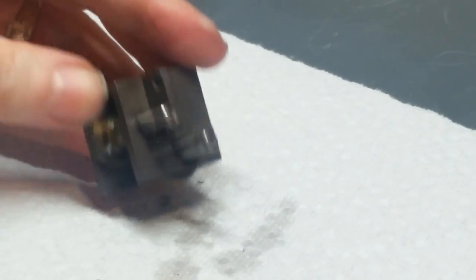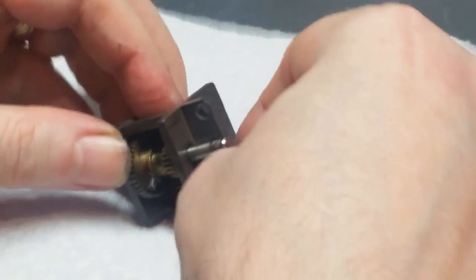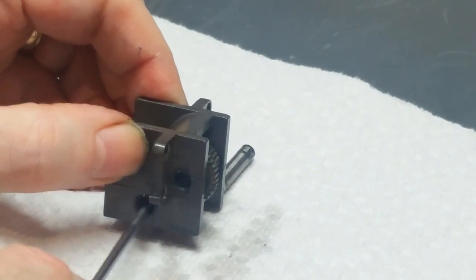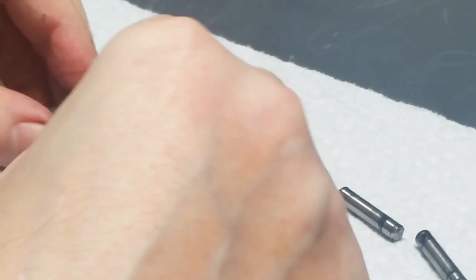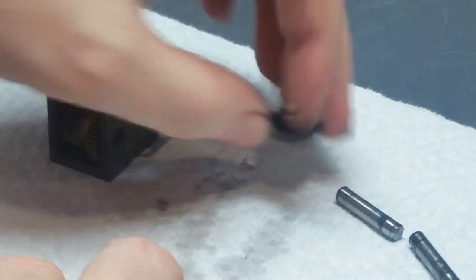Okay, as you can see, the pins are coming out. Cool. So let's go ahead and push those all the way through. Now these guys are out. These gears are now theoretically free. They don't seem to know it yet, but they are, and they'll come out.